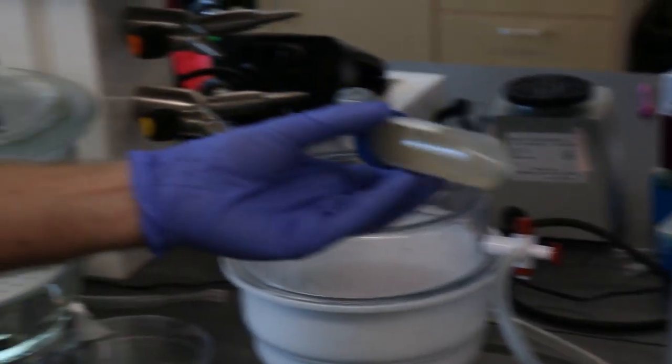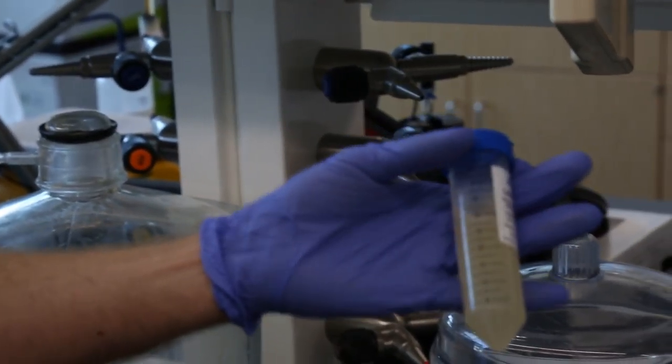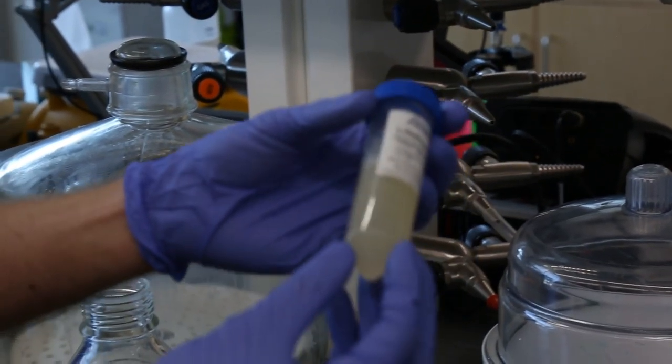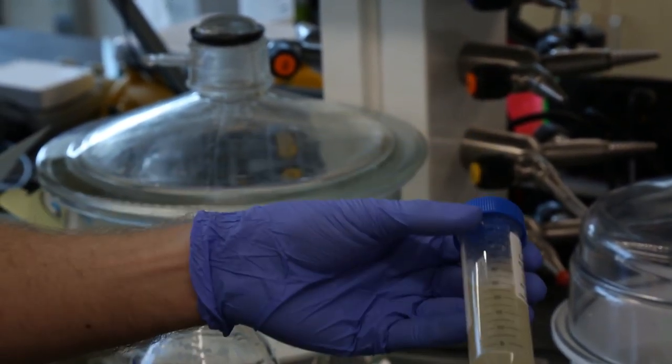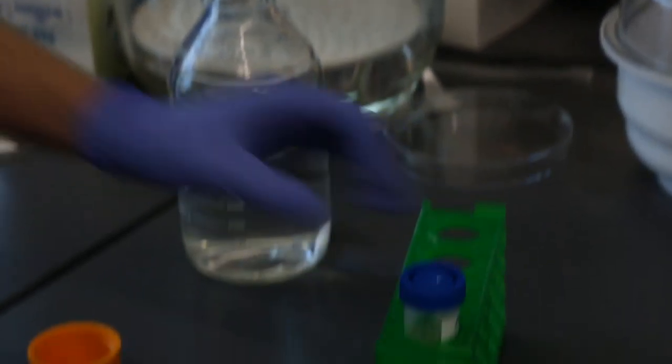Once that's nice and rehydrated, we're gonna let this sit for around 10 minutes just to ensure that everything is fully rehydrated. Otherwise it can continue to swell very slightly if you rush this process, so we're just gonna let this sit and come back in a couple of minutes.